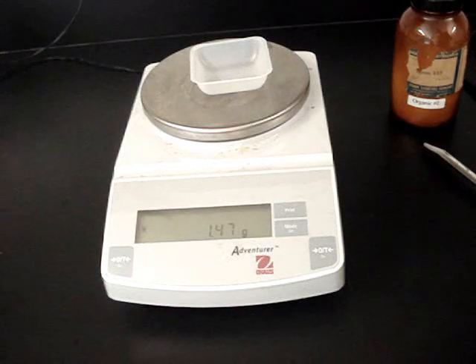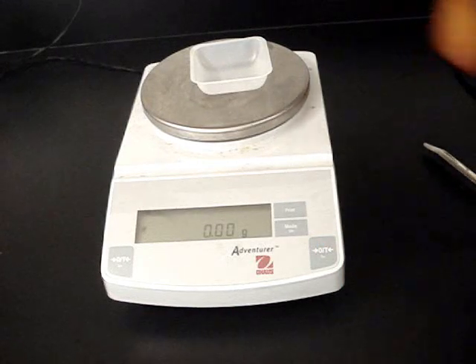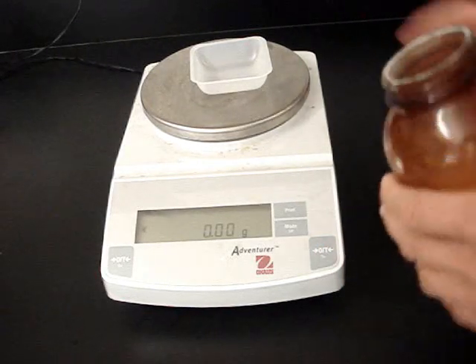If I add the sugar to it, that'll be the mass of the sugar and the weighing dish. But I don't want the weighing dish, so I can hit the tare button. That'll subtract the weighing dish. And now I can pour the sugar in.